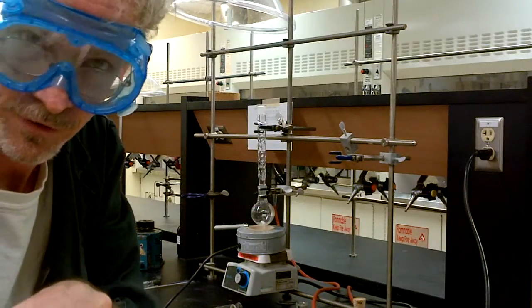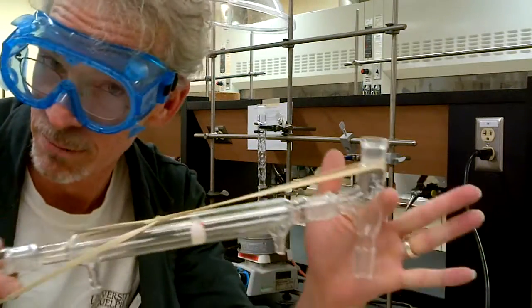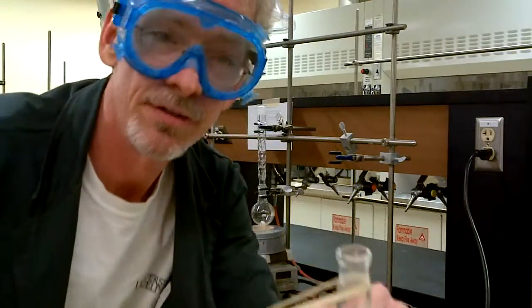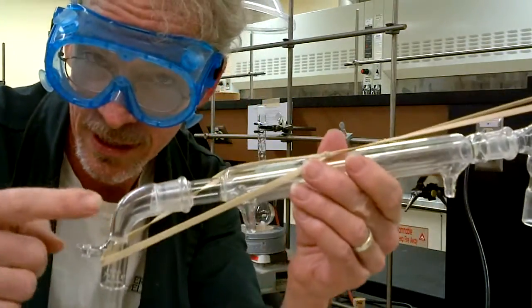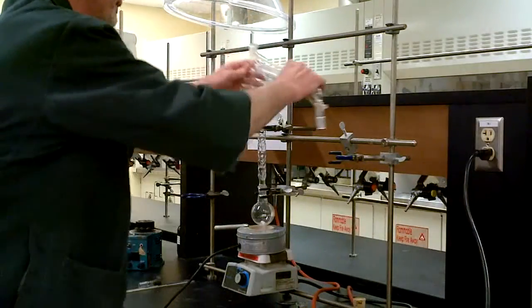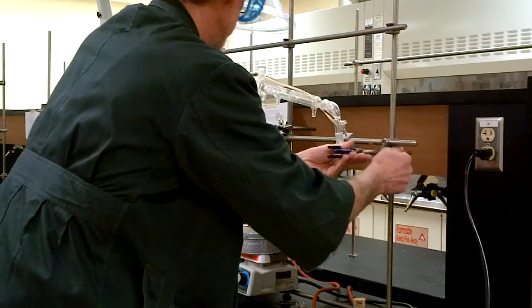Once again, the magic of rubber bands holds our pieces together. We have the still head, a cooling condenser, and the vacuum takeoff. There we are, nice. So that goes in that position there.